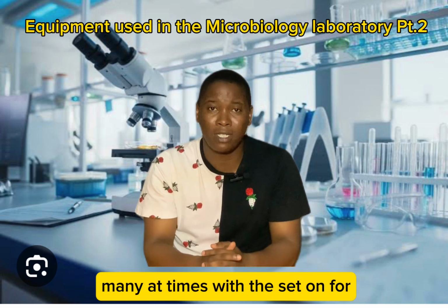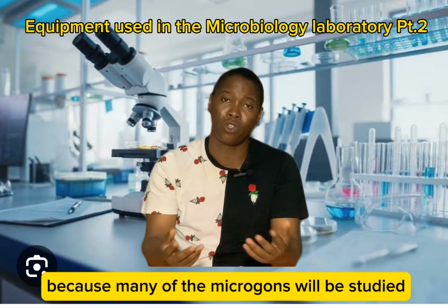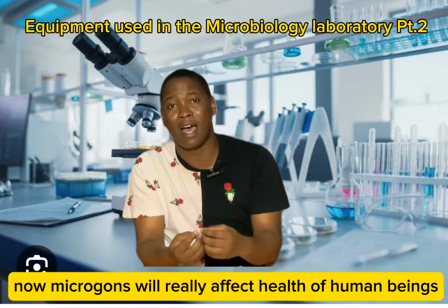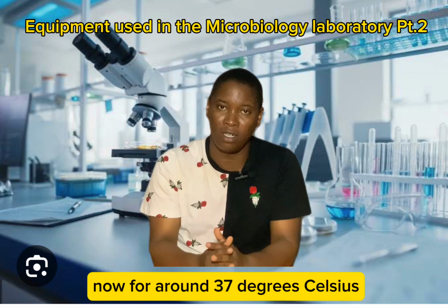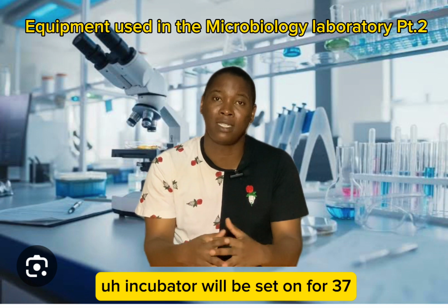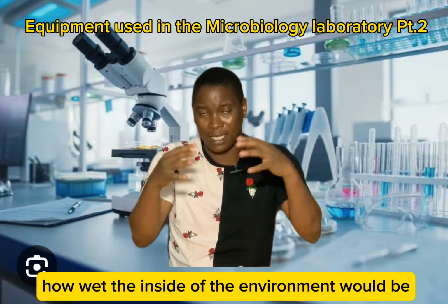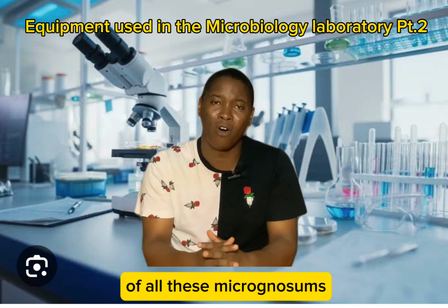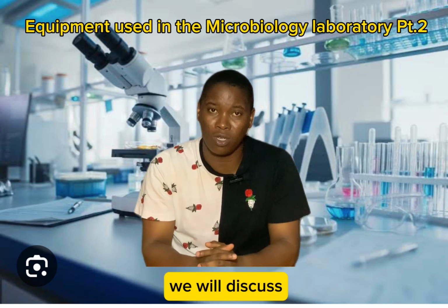Many a times we dey set am for temperature of about 37 to 42 degrees, because many of the microorganisms wey we dey study for this part, or many times the microorganisms wey we dey study na microorganisms wey dey affect health of human beings, and usually body temperature na for around 37 degrees Celsius. So e dey important. Many times the incubator we dey set am for 37. So apart from temperature, also the incubator dey set humidity, how wet the inside of that environment go dey, and e dey important because e dey encourage the growth of all these microorganisms. So that one na the first equipment wey we go discuss na incubator.